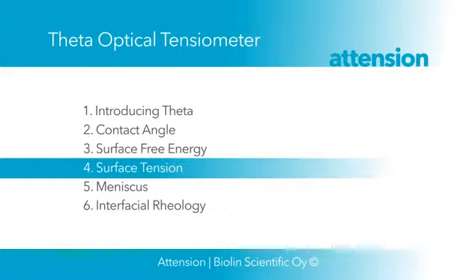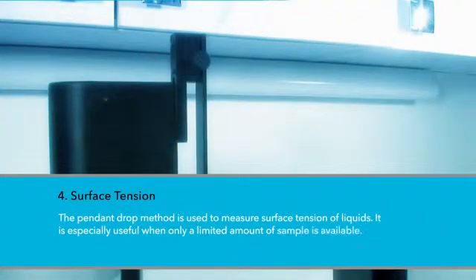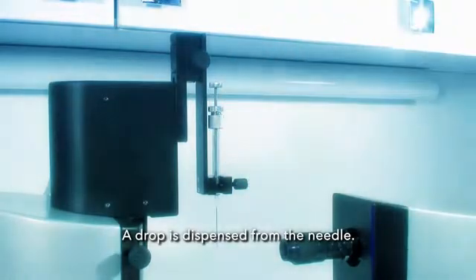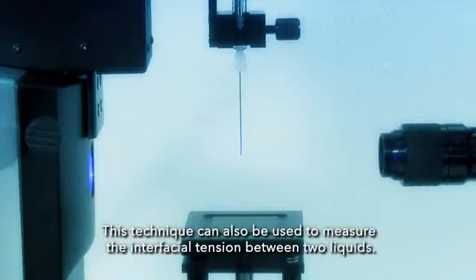Next, we will measure surface tension. The pendant drop method is used to measure surface tension of liquids. It is especially useful when only a limited amount of sample is available. A drop is first dispensed from the needle. This technique can also be used to measure the interfacial tension between two liquids.